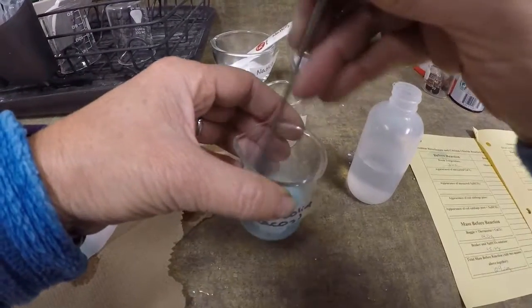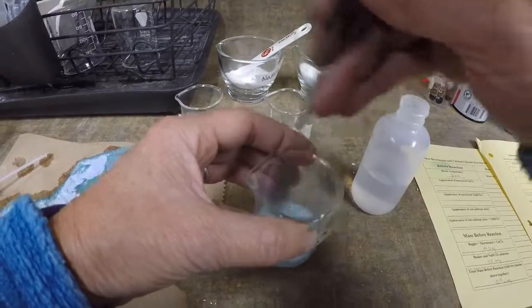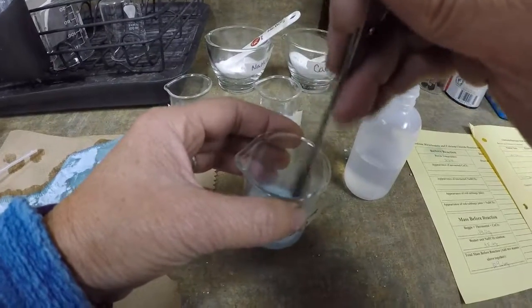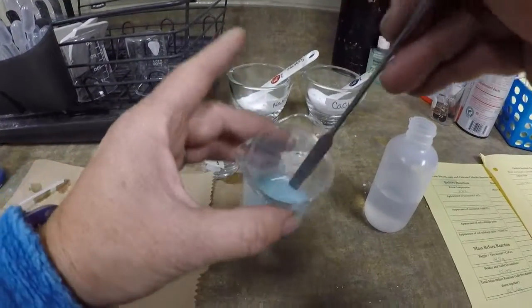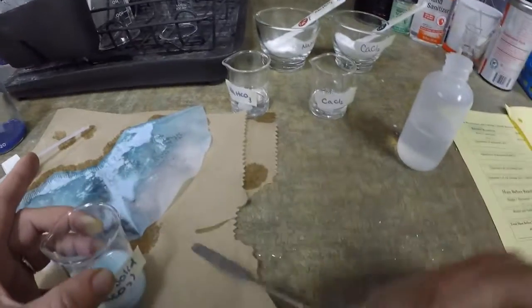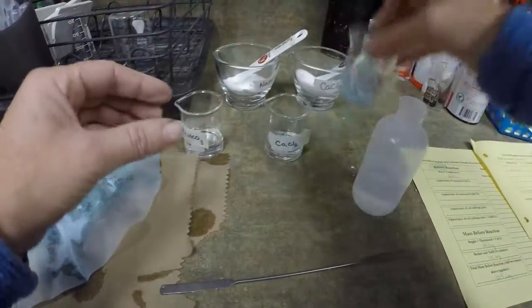my calcium chloride. And first off, what I notice, so the color is from the red cabbage juice, so we're not going to worry about the color difference. But we're going to notice I don't have a nice clear solution, and I'm not able to dissolve my product. If I filtered it out, I'd end up with the same thing in the filter paper and water on the other side.